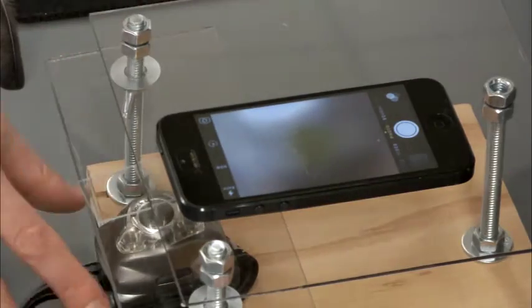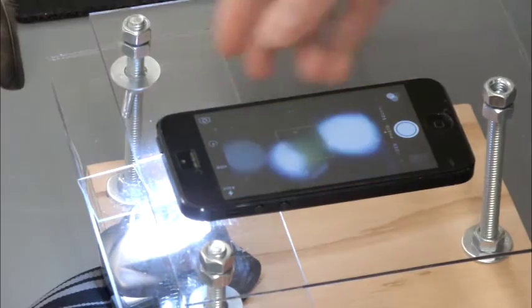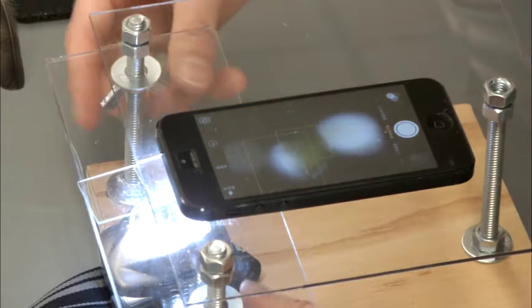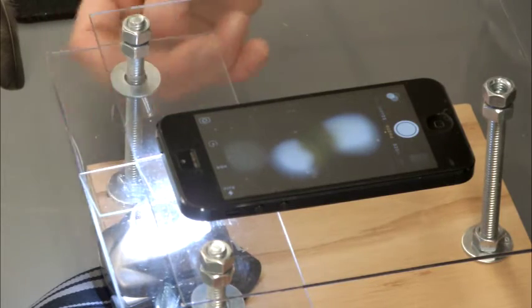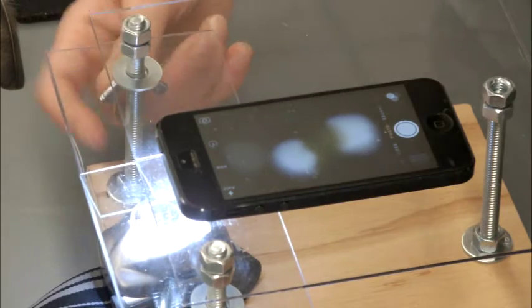Okay, and for this one, this Elodea leaf, we're going to go ahead and use the light to shine underneath it. So the nice thing about these wing nuts, and the purpose of the wing nuts on here, is that you can adjust the level at which your specimen stand is sitting so that you can kind of get your specimen in focus.